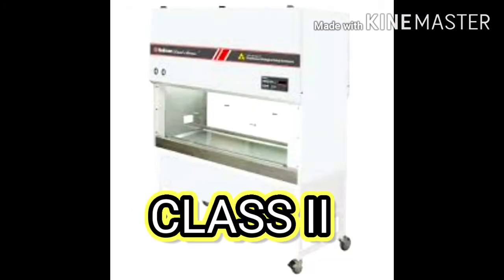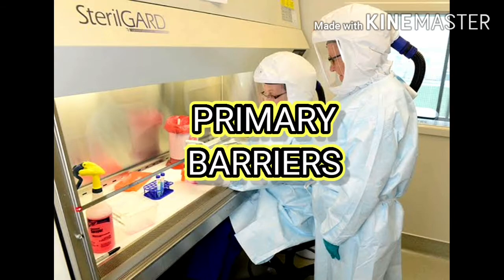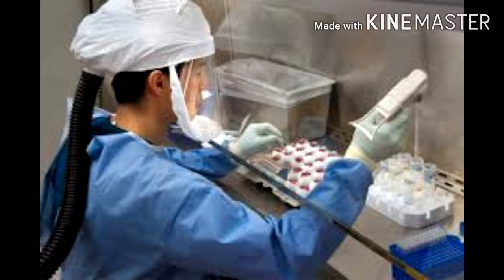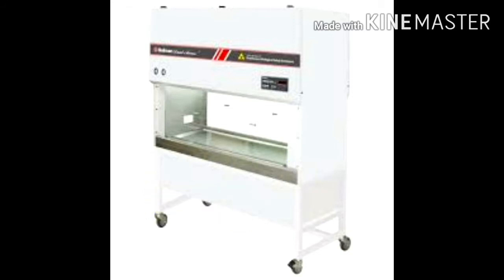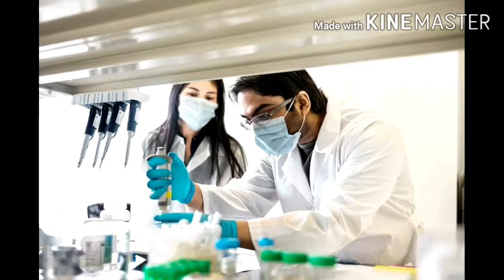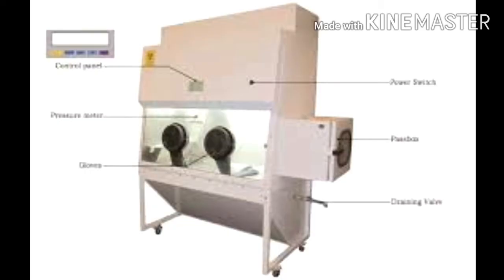Open-fronted Class 1 and Class 2 biological safety cabinets are primary barriers which offer significant levels of protection to laboratory personnel and to the environment when used with good microbiological techniques. The Class 2 biological safety cabinet also provides protection from external contamination of the materials being manipulated inside the cabinet, such as cell cultures and microbiological stocks.